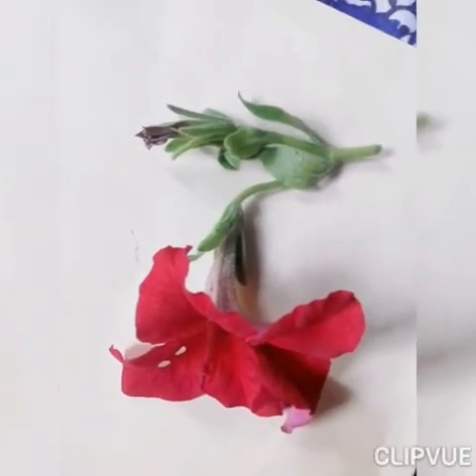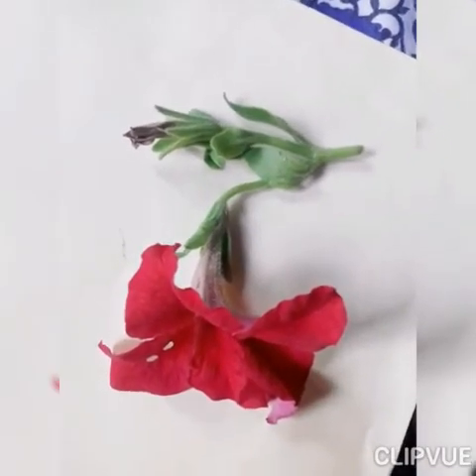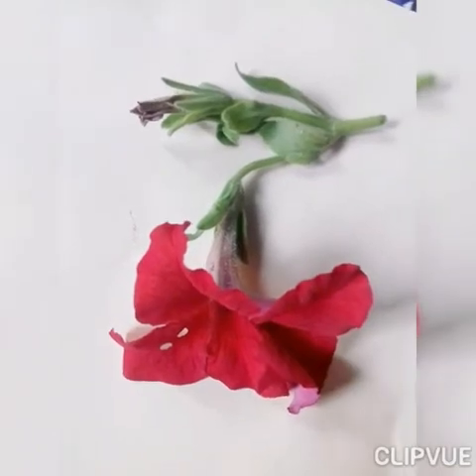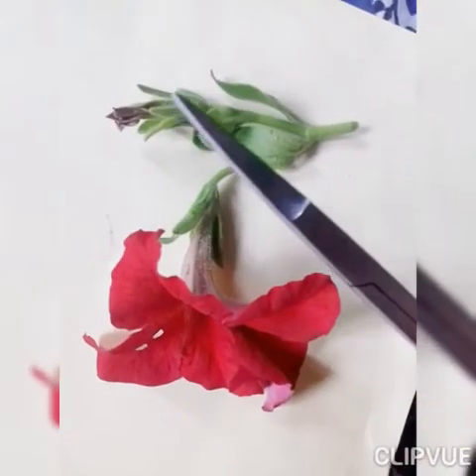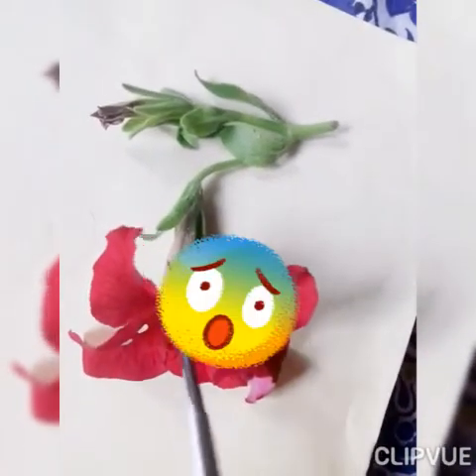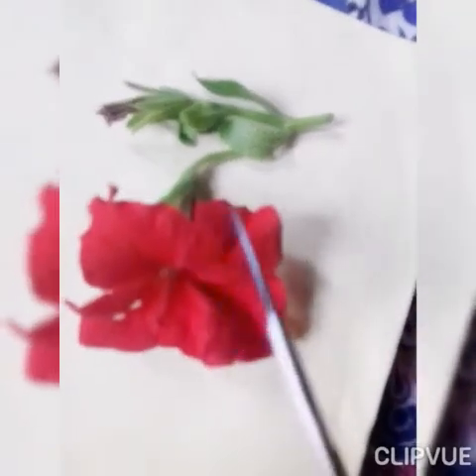Now I'm going to cut this flower longitudinally in order to see what is present inside the flower. I have a scissor that will be used to cut this flower longitudinally.